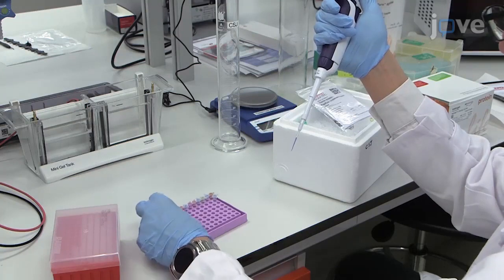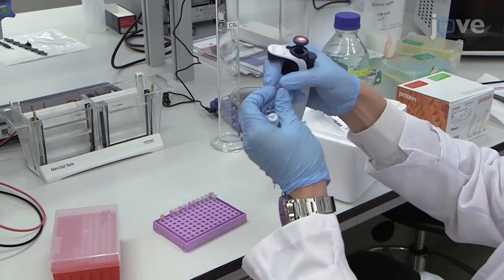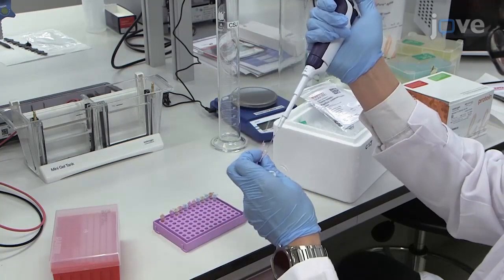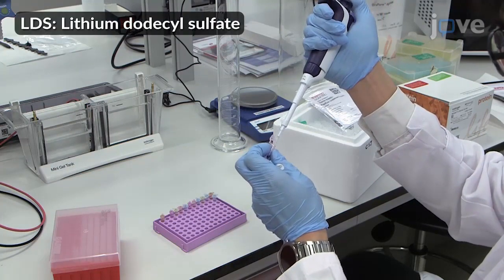To begin this procedure, dilute the protein samples with a solution containing distilled water, LDS buffer, and a sample reducing agent.